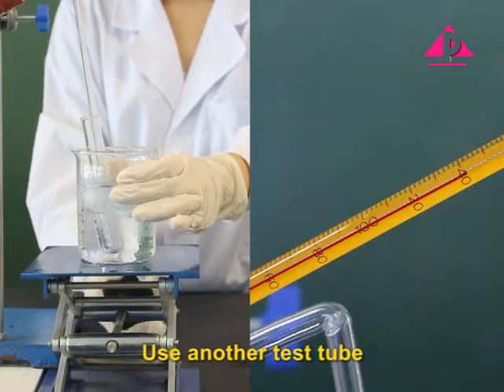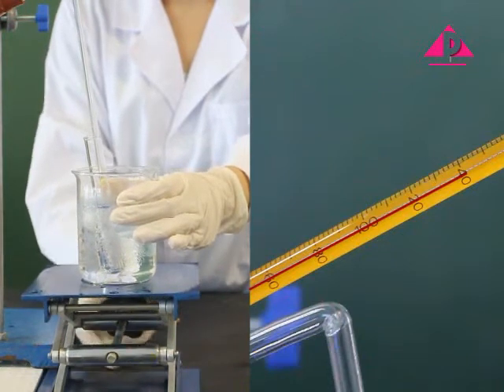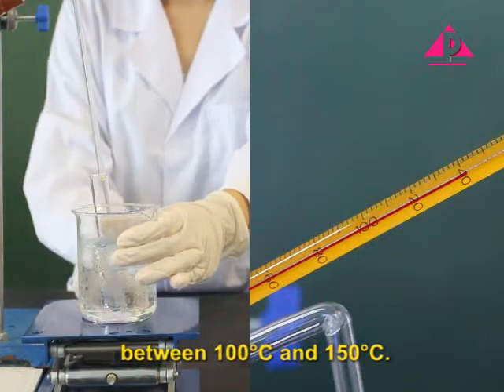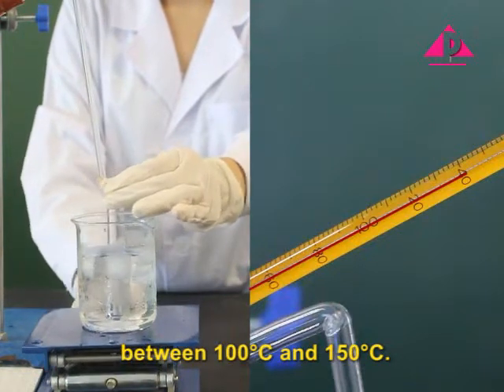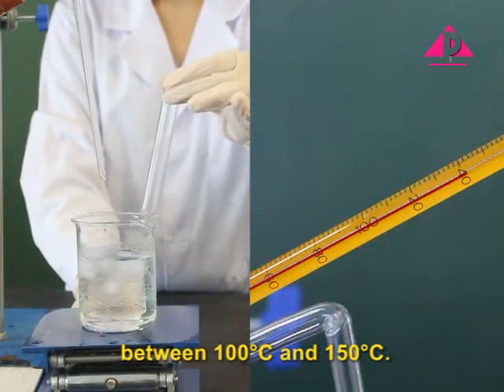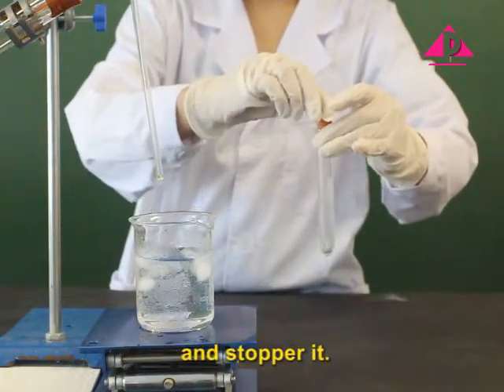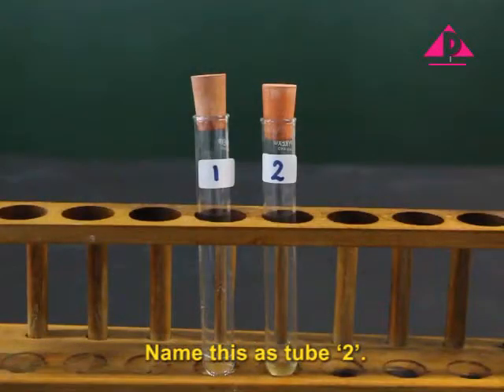Use another test tube to collect the distillate, fraction 2, with a boiling point range between 100 degrees Celsius and 150 degrees Celsius. Remove the receiver tube and stopper it. Name this as tube 2.